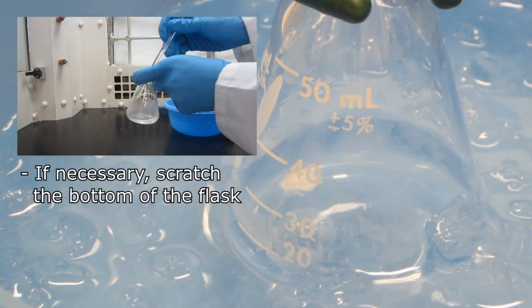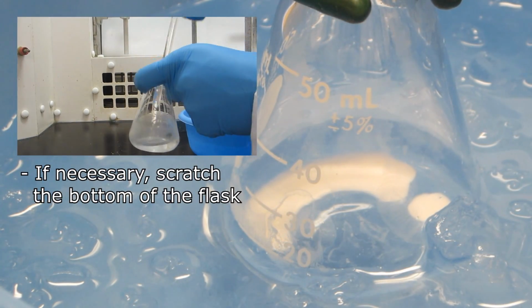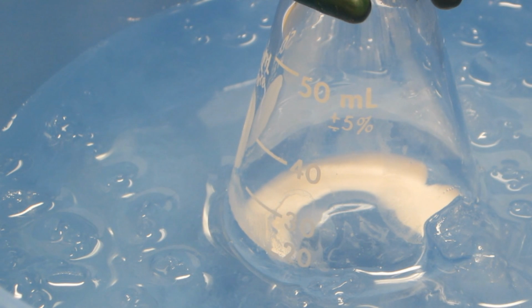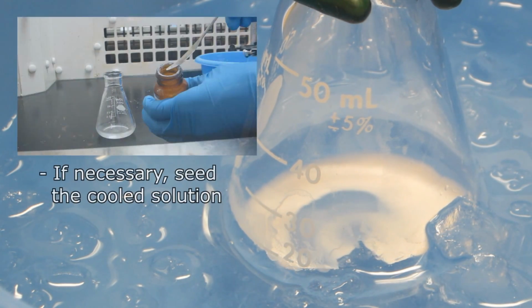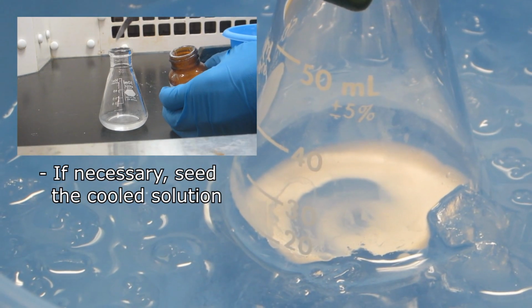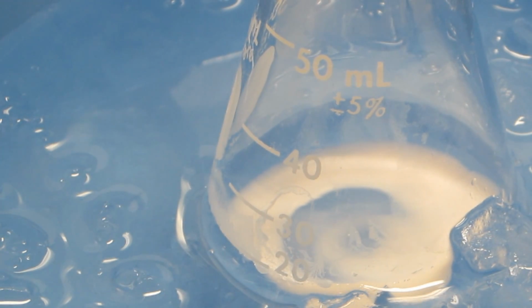If no crystals form, scratch the bottom of the flask with a thick glass rod. This may promote crystallization as a thin glass etch can provide a surface for which the crystals can form on. If crystals still do not form, seed the solution by adding a few small crystals of the original compound. Again, this provides a surface for the crystals to form upon.